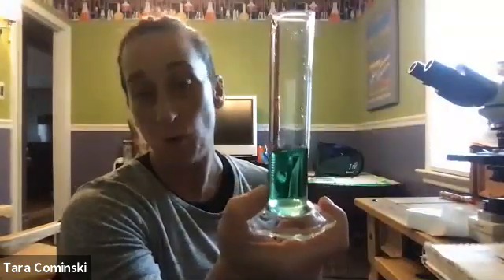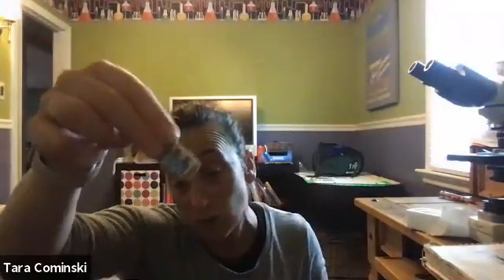So remember we had our object here that we determined the volume of, right? I'll kind of tell you the answer to this one. You have this liquid in here. You know it's at 20 mils, right? Remember in the beginning of this exercise for volume, we measured the length, the width, and the height of this, right? And we determined that that is equal to the volume in milliliters, right? That cubic centimeters is equal to milliliters, okay? So whatever answer you got there, you know this volume.